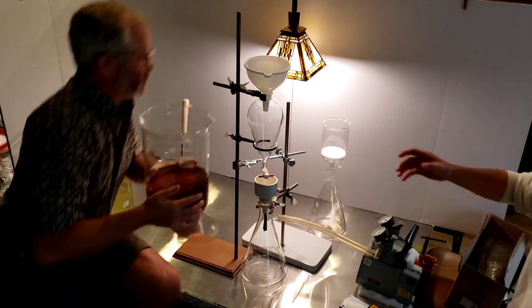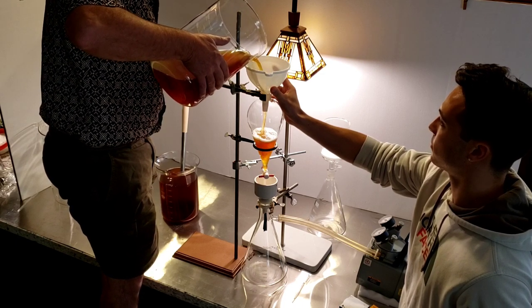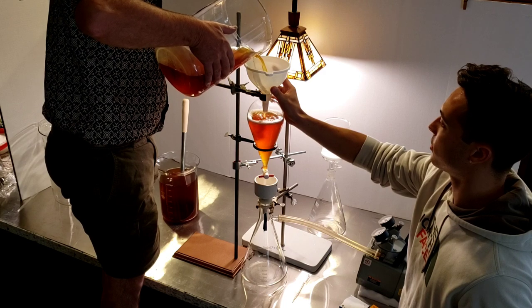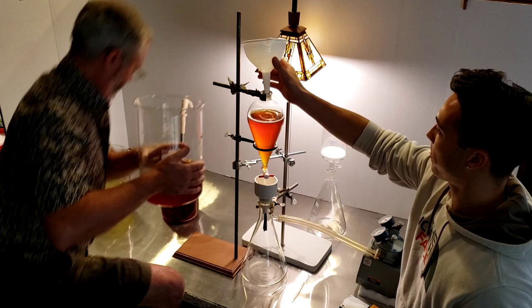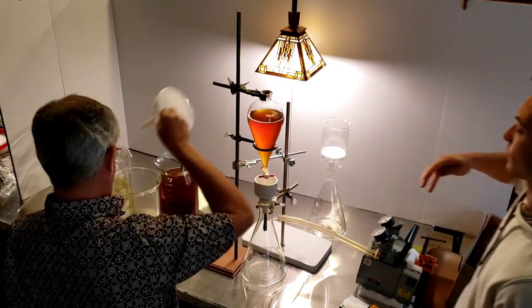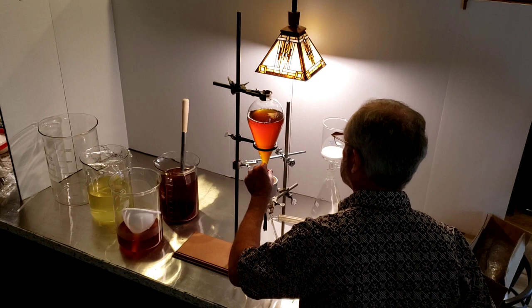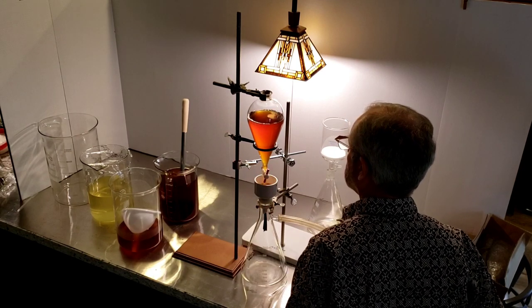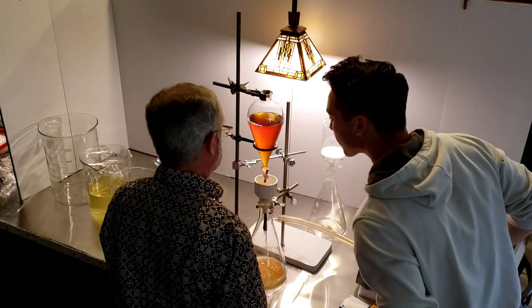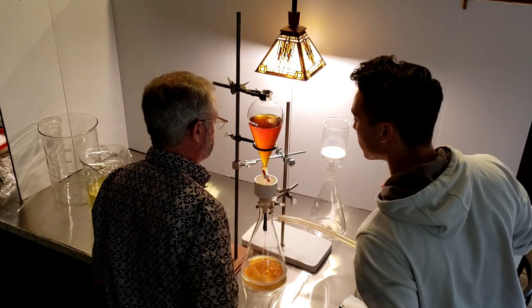Do you want me to hold the funnel? Sure. Keep it coming. That should be good to start. Put that down in there and turn this on. Actually fill that up. Turn it on. It's sucking it down faster than I can put it in — I would take it a little lower. That's it. Alrighty.